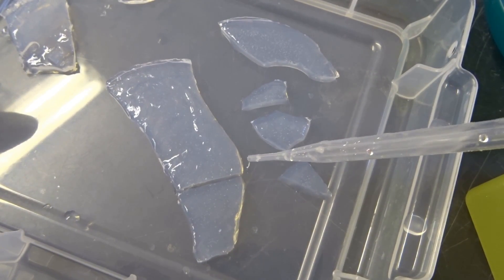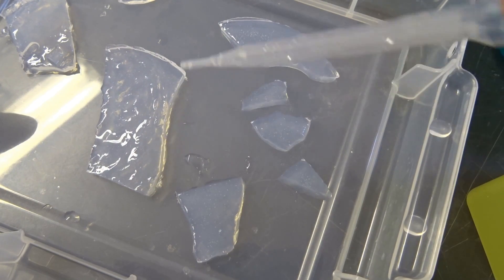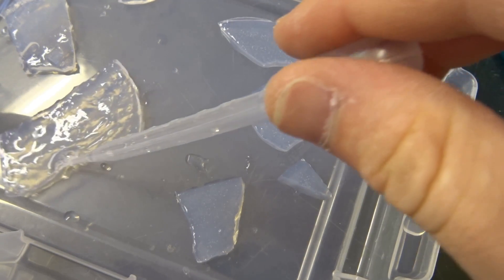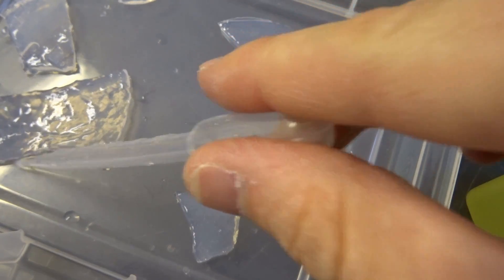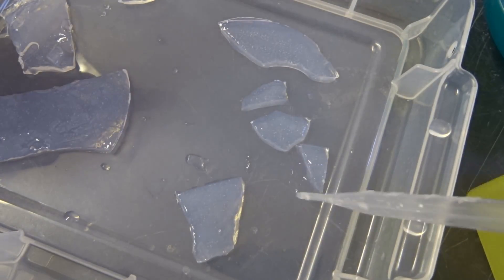I've made already two parts. Here you see the gels after I pulled them out of the water, which I'm going to show you how to make them later. But first I want to go a bit back into history.